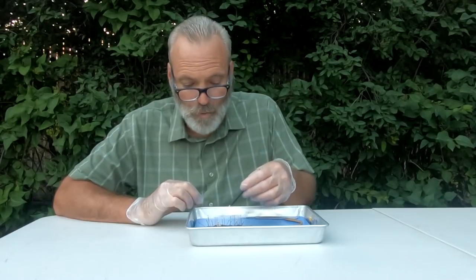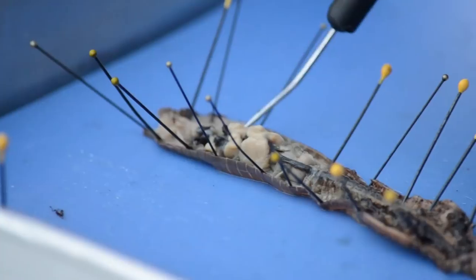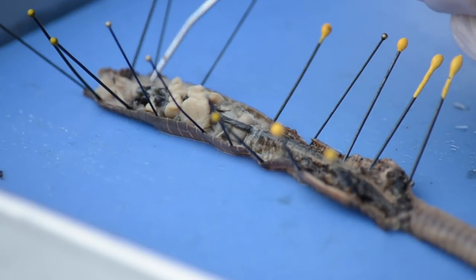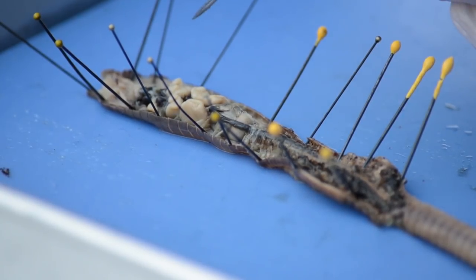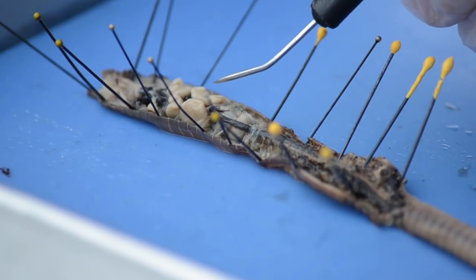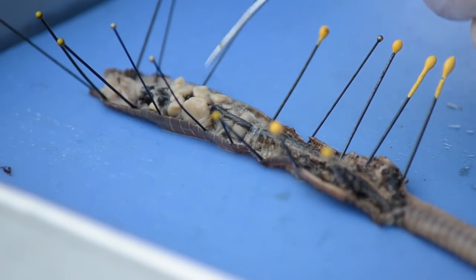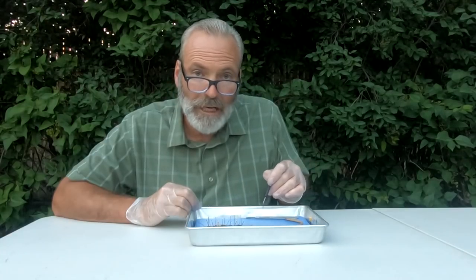Let's take a look at some structures around the esophagus. These little black tubes right here — there are five of them and they're called the aortic arches, or hearts if you will — tubes that act as hearts. A little farther down you have these white little fleshy organs called the seminal receptacles and seminal vesicles. The seminal receptacles are the smaller ones — they receive the sperm from the other earthworm. The seminal vesicles produce the sperm to be delivered to the other earthworm. Running on top here dorsally is this vessel — that's the dorsal blood vessel, and it runs the entire length of the annelid.